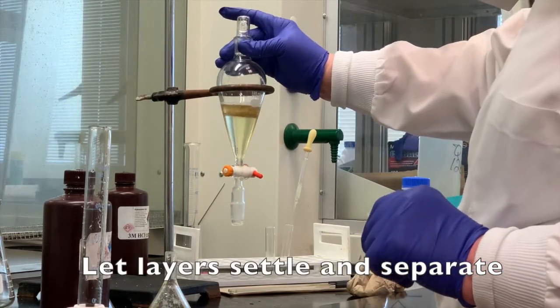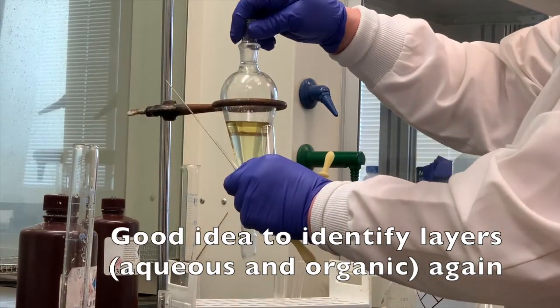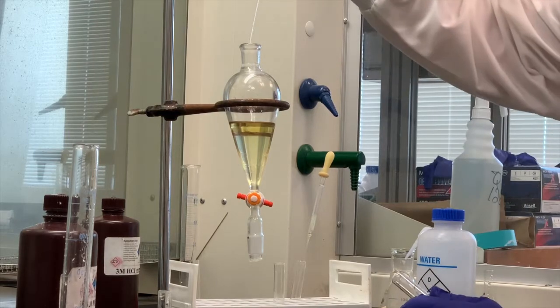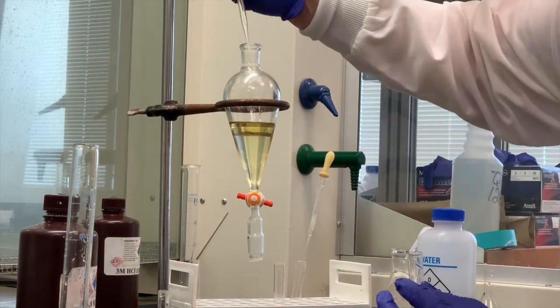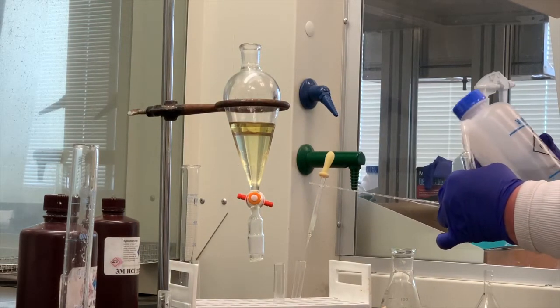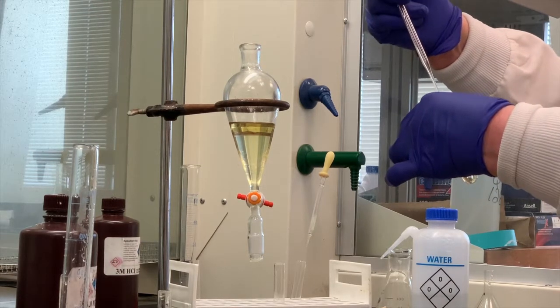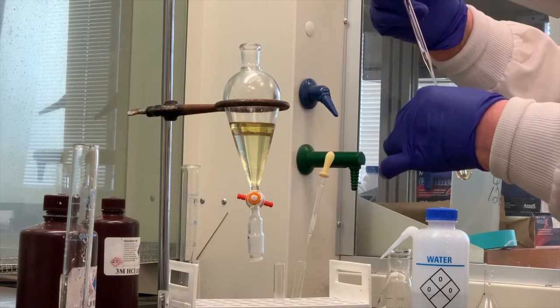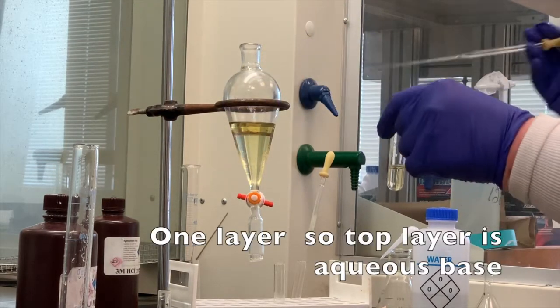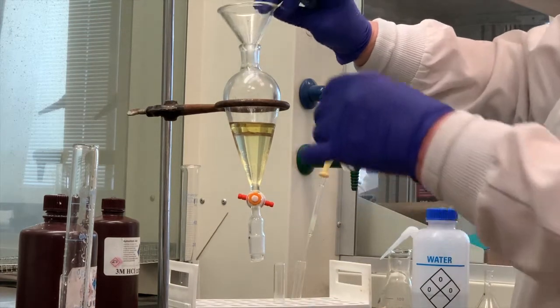Let that sit just for half a minute or so, just to allow good separation of the layers. And remember, it's a good idea to identify the layers again, which is organic and which is aqueous. So I'm going to take some of the top layer off. Remember, I'm not wasting anything. I'm going to add some water to it, about as much as I have in the test tube. And then I'm just using a pipette to mix all substances together in the test tube. And as you can see, one layer. One layer means the top layer must be aqueous since it dissolved in the water. So I'm going to, again, not waste this. I'm going to go back and pour that in.